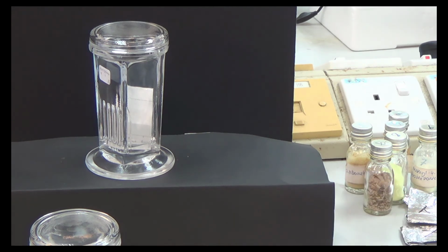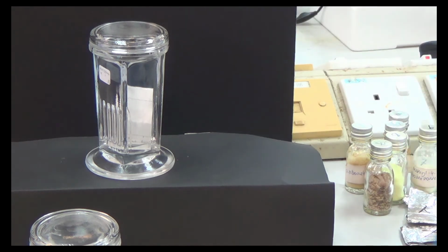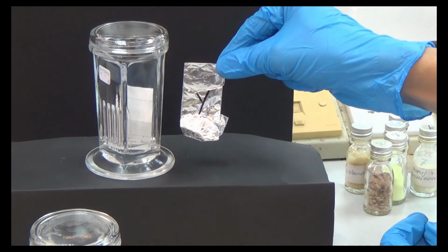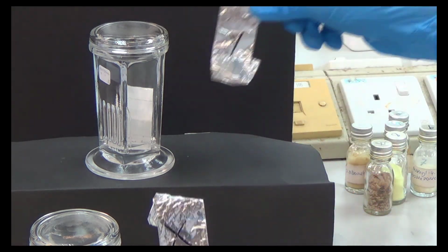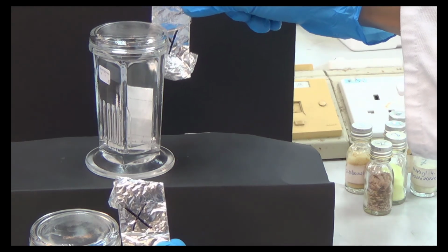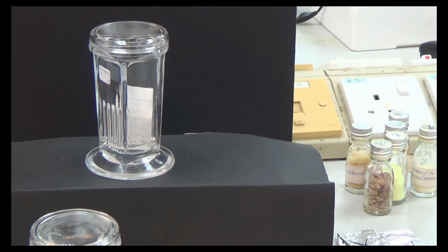The question that I ask is why, for the unknown Y, we use this one, but for the X here, we use another. Y is here, X is here. Why do we use a different solvent? That's the main question. Why not use the same solvent? Can I try? Yes.